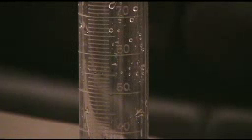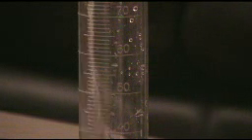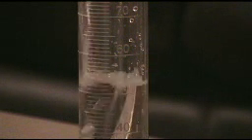That's easy enough. But how would you find the volume of this marble? Remember that solids have volume too. Volume is the amount of space that something takes up. You can't just take the marble and throw it in the graduated cylinder and say, okay, well, that's my volume. Instead, you're going to use something called water displacement. The first thing that you want to do is pour water into your graduated cylinder. It doesn't matter how much water you put in there because you're just going to use the water to measure.